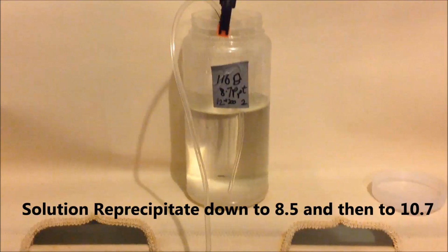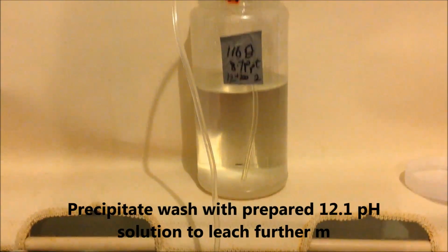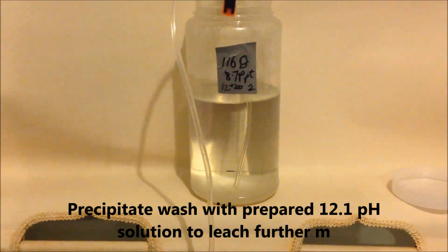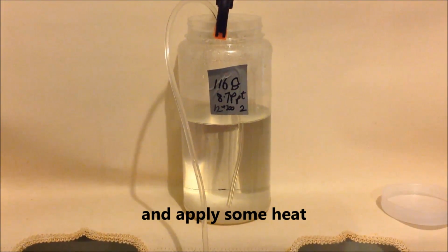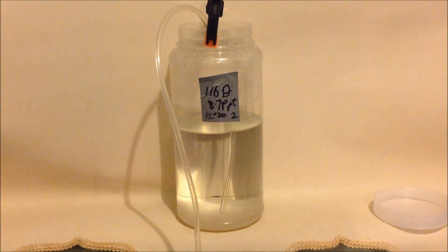That supposedly will be the dissolved M state, if any. And the precipitate, I'll add more pH 12 solution to that, perhaps in a smaller container, and bring them both to the, not so much to the boil, but heat them up and just observe whether any difference is between the two.